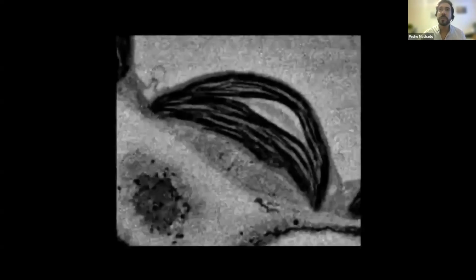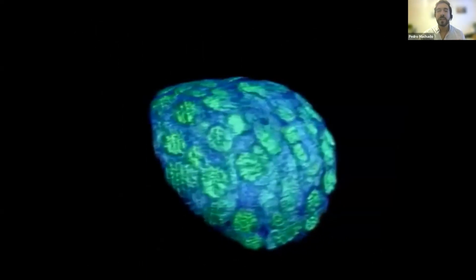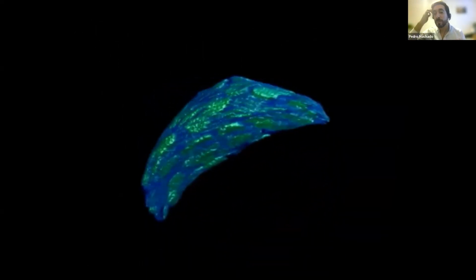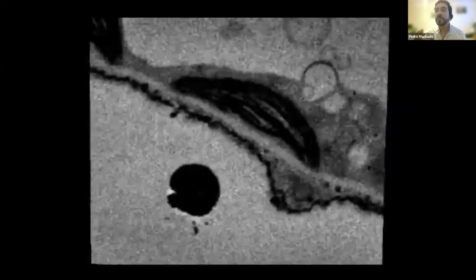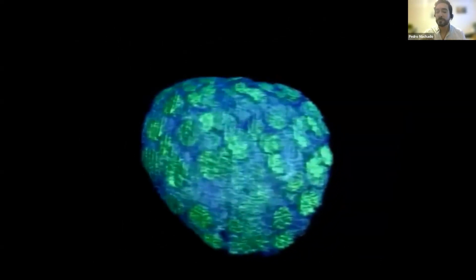What we want to achieve with our volumes is some contrast, and here you can see a quickly segmented chloroplast of Arabidopsis, and it's being rendered on Amira. So contrast is key if we want to analyze our structures, if we want to get our segmentation, and if we want to go towards quantitative EM.